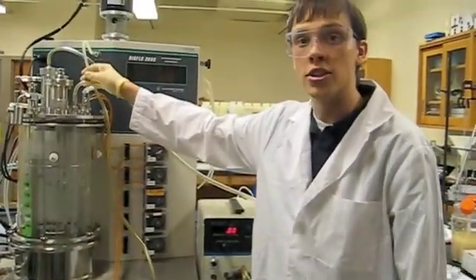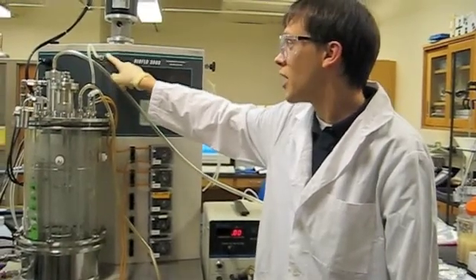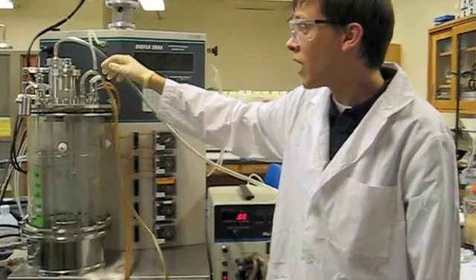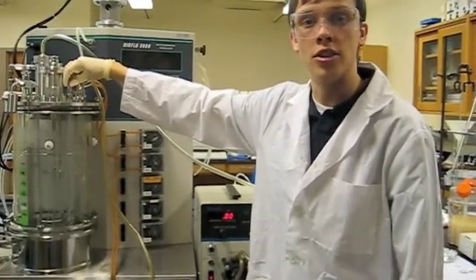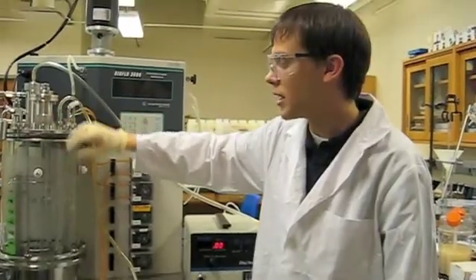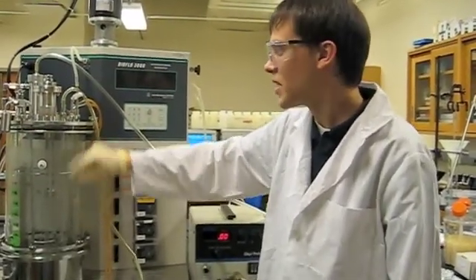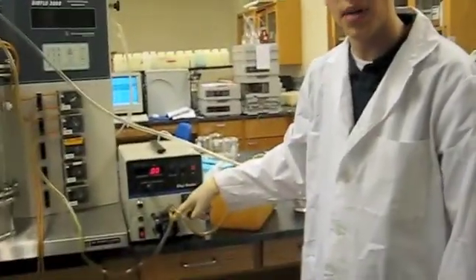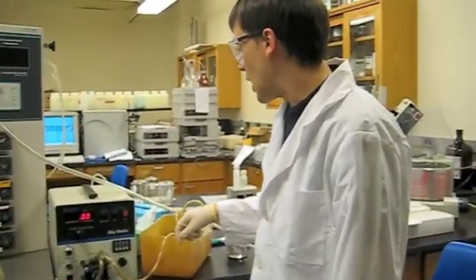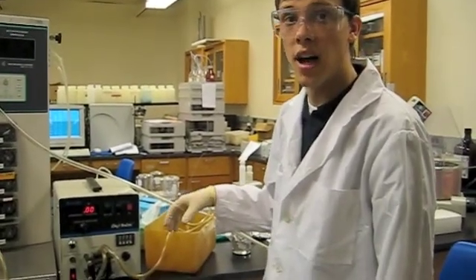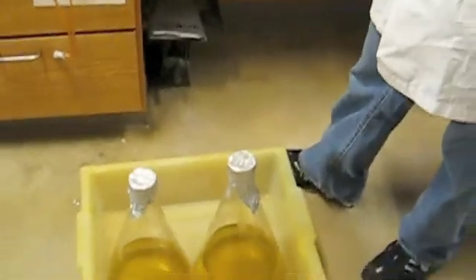I've also hooked up our sparger tubing, which goes from the sparger out to our sparger port. I've also hooked up our tubing that we will be putting our inoculum and our media into the vessel. As you can see, I've hooked it up. It's going through a peristaltic pump and coming out, and I'm going to now sterilize the tubing with ethanol, and then we will put our media into our vessel.